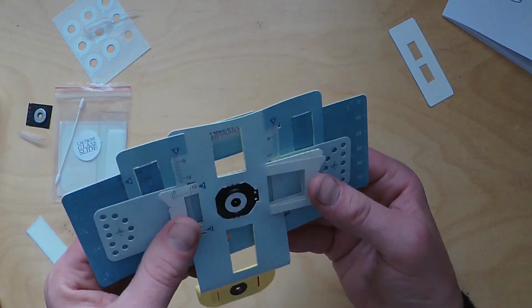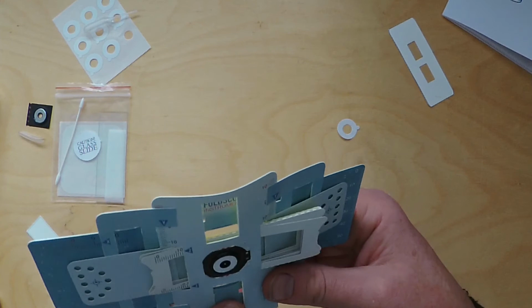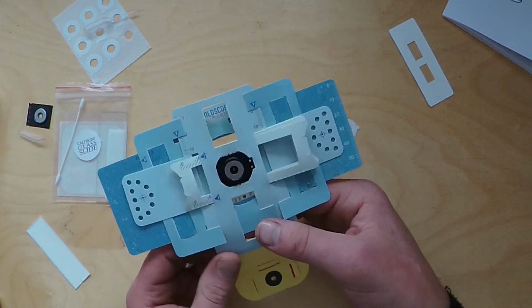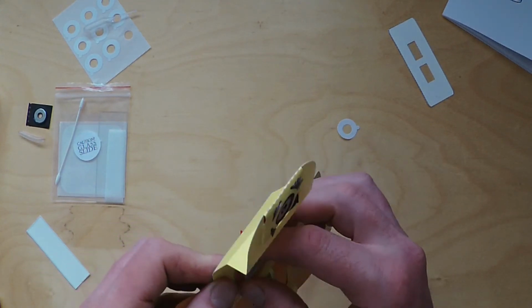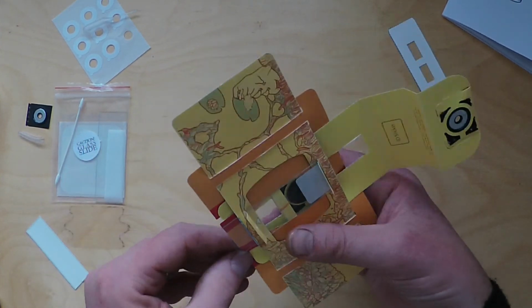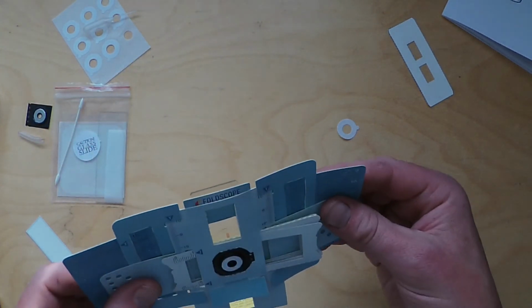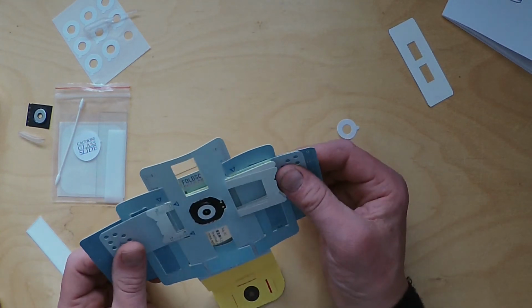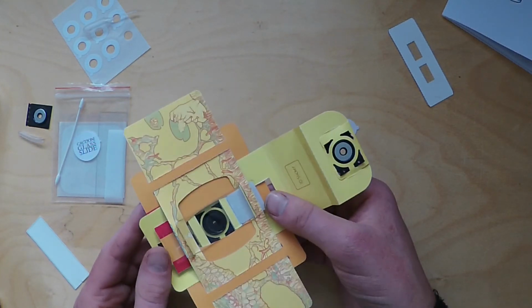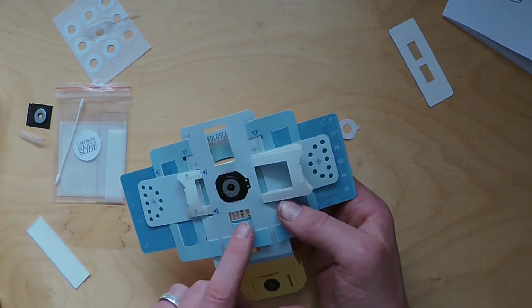Now you'll see the slide is sort of close to the lens. Okay, so flip it back over. Make sure all the tabs are there. They can slip off actually. Yeah, there are other tabs there. I forgot to bring them up too. That keeps it in position. Make sure you've tucked those in as well, and that keeps everything together. Yeah, there you go. Okay, so now position your slide nicely in the middle. So remember, the sticker side closest to the lens. We can just peek through and see the slide through there.